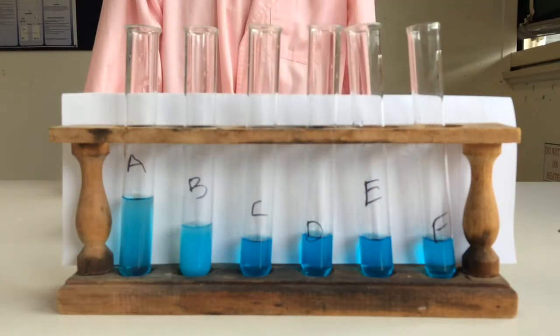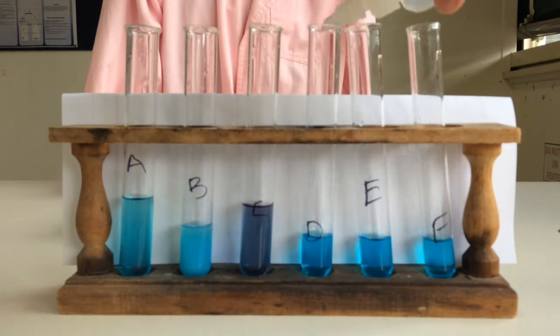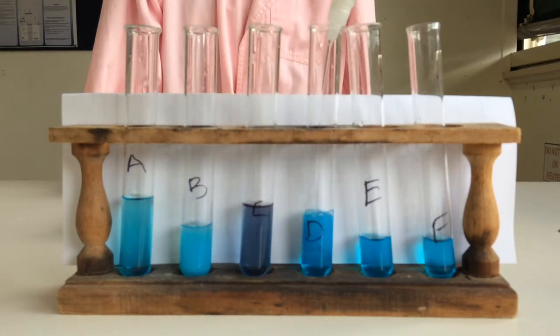What I'll do once I'm finished is I'll hold them up so that you can see them a bit clearer to see if there's a precipitate. If it just changes colour, but there's no solid, then it's not a precipitate, okay? Next one, sodium hydroxide. Sodium hydroxide is a really strong base. And the last one is potassium iodide.